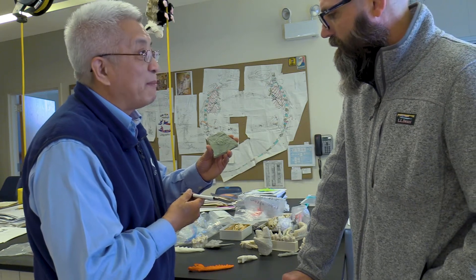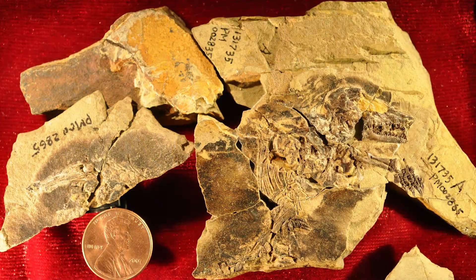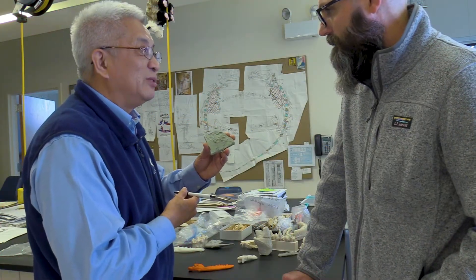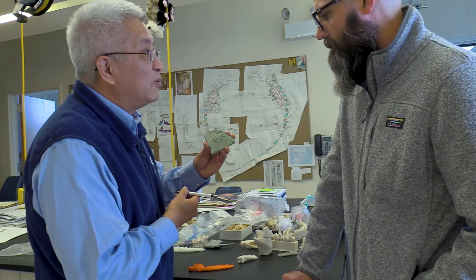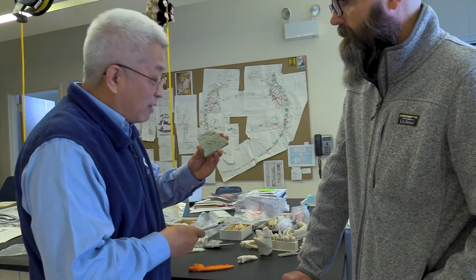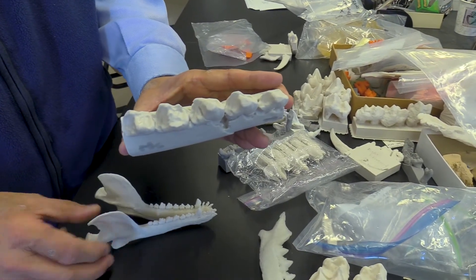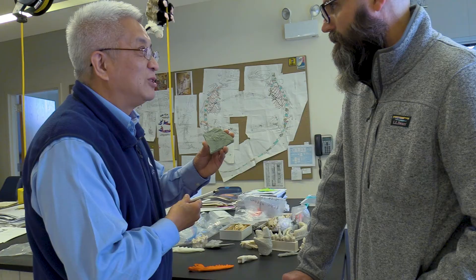The best we could manage for such a small and fragile fossil was to expose it, take a photograph, and be satisfied with that. To remove it from the rock is next to impossible — the fossils are so tiny and frail that if you move them out of the rock they lose support and can disintegrate in no time. We mostly prefer to leave them inside the rock. However, now we have CT scanning: we can see through the rock and visualize the underside of the fossil with digital technology.